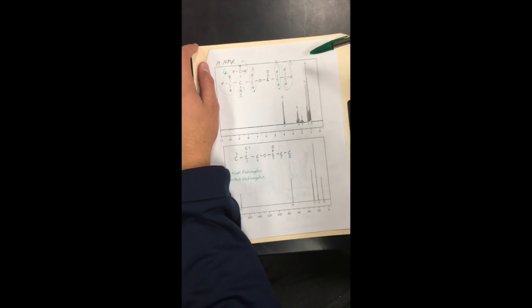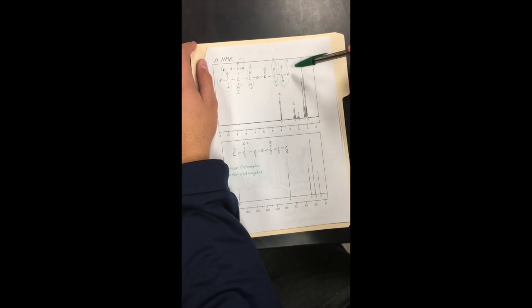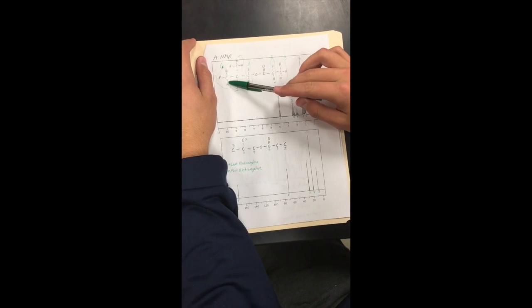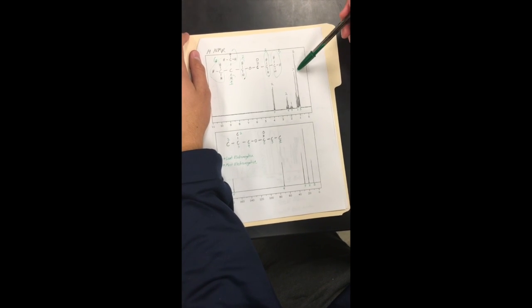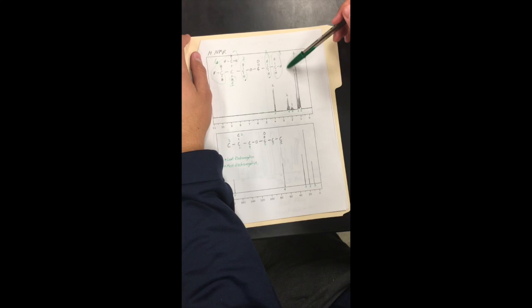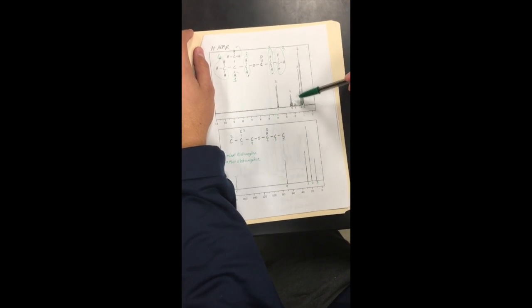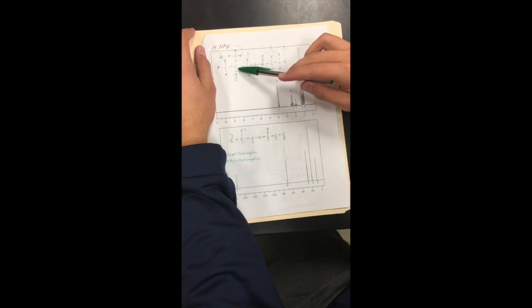Alright, next we're looking at HNMR. So the integration numbers were 6, 3, 1, 2, and 2. So first we look over here, which we found to be a primary alkyl, which correlated to 6 hydrogens here with 2 CH3s, which integrated to this 6. Next we had 3 as a number for hydrogens, which correlates to this CH3 right here. Then we have the 1 down here at the bottom, which we found to correlate to this 1 hydrogen off the carbon right there.